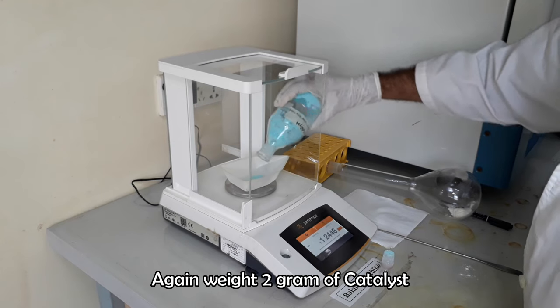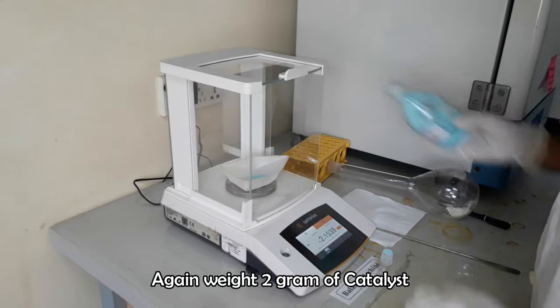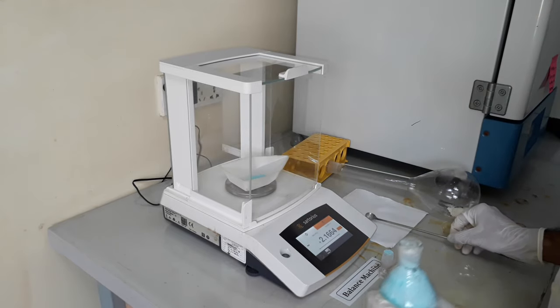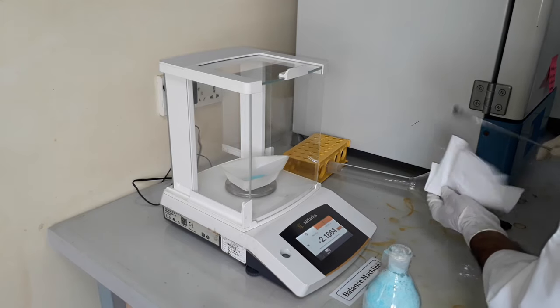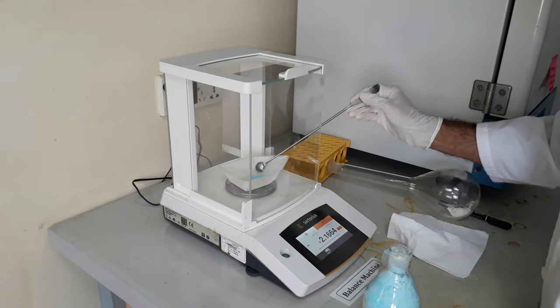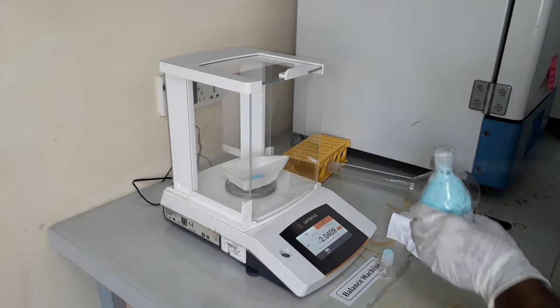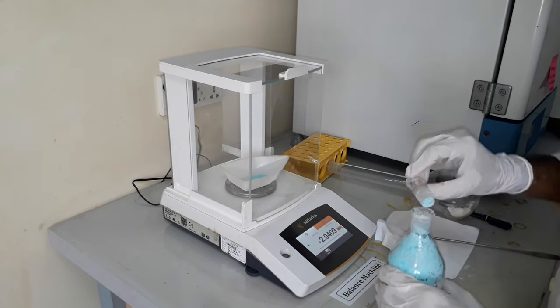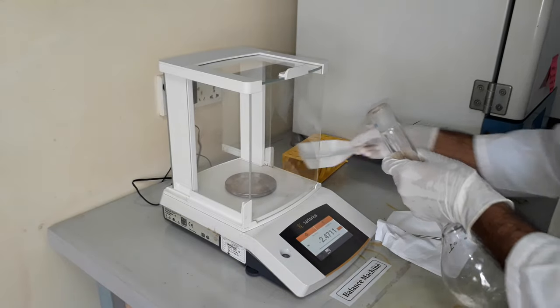Again weigh 2 grams of catalyst. Add the catalyst to the same flask that contains the sample.